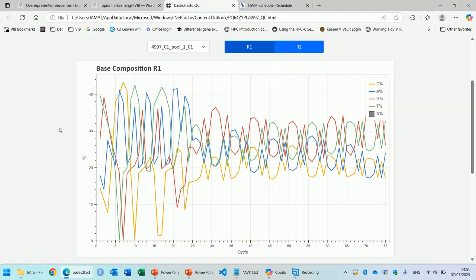Sometimes you can even guess the sequence of this contaminating sequence by just reading the pattern in the peaks here. So in this example, if you start at cycle 30, you see that we get a G, another G, and then something that is either an A or a T. Then we get another G, then we get an A again, another A, and then something that is either an A or a T, and so on. Contamination in the library is often caused by adapter dimers. We will come back to this later.